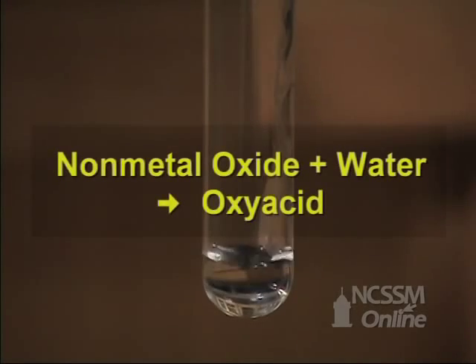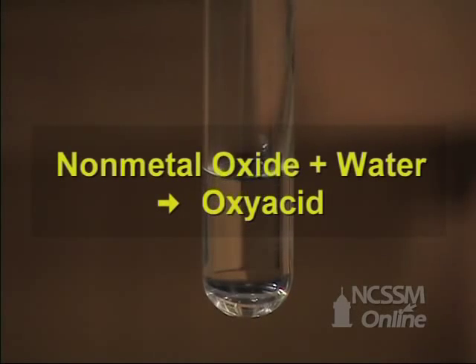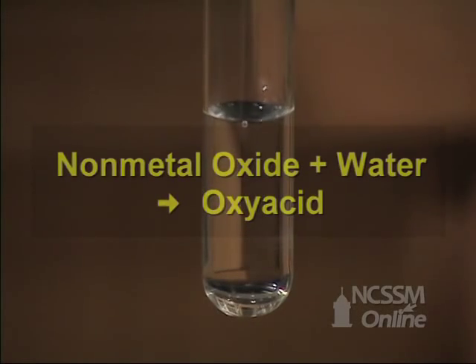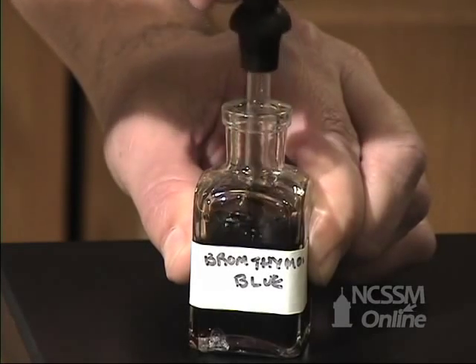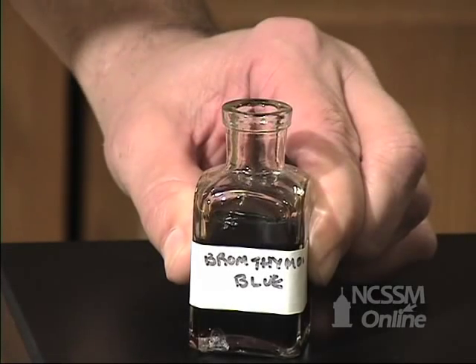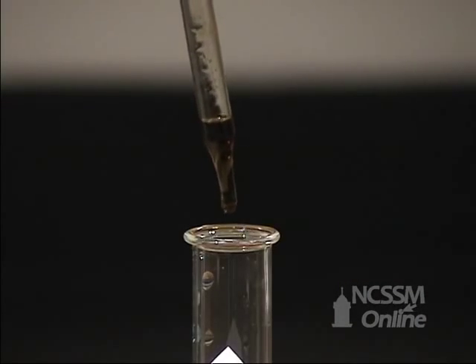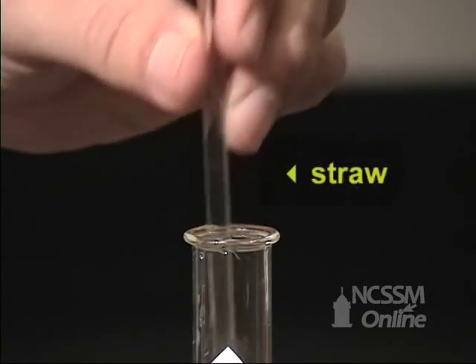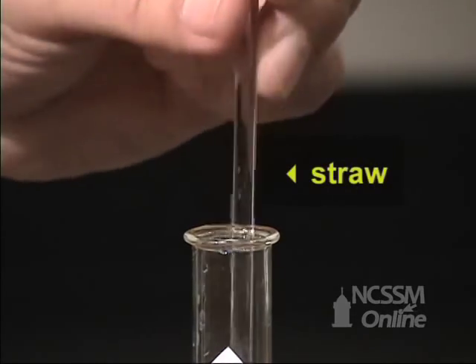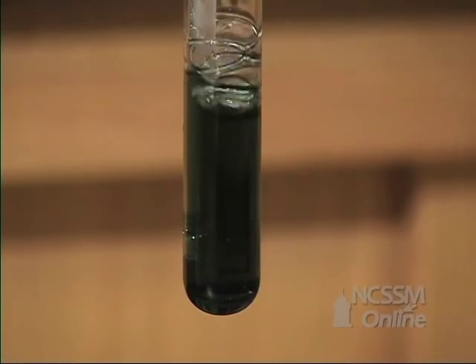Non-metal oxides react with water to form oxy acids. In the reaction that we're running, we're going to take carbon dioxide, conveniently provided by a breathing person, and bubble it through water.